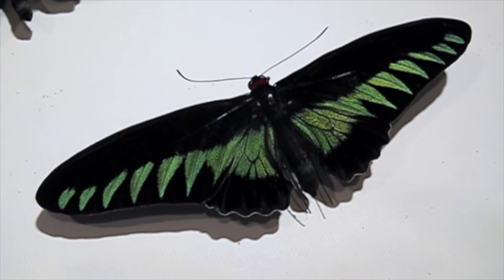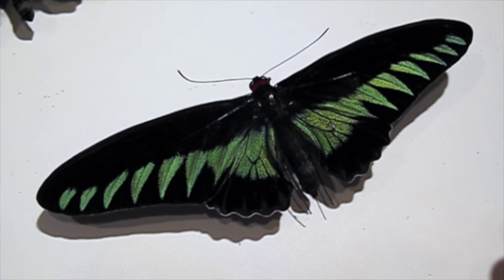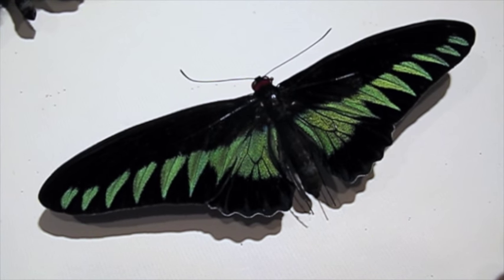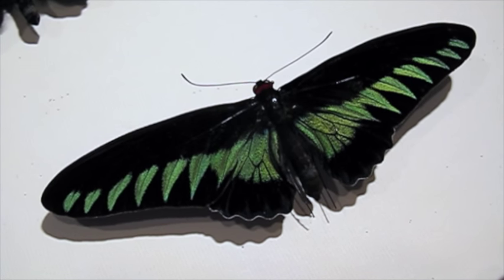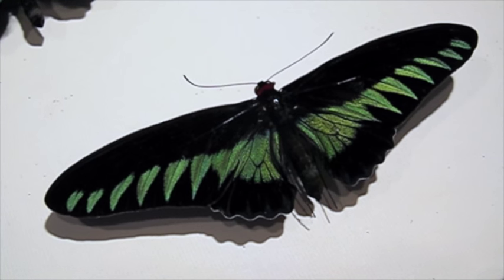And finally I have one last specimen to show you. This is one that I pinned in the resting position. So if you saw one along a stream side in a forest in Malaysia, this is the position they take when they're naturally at rest.